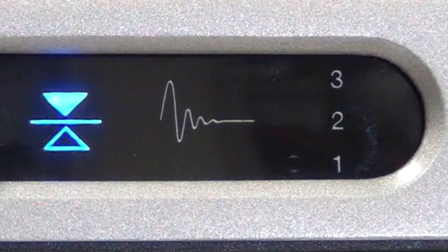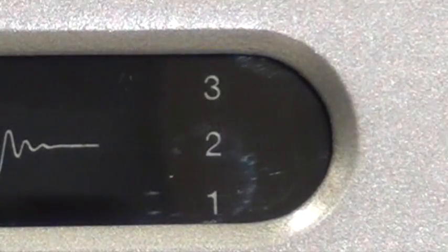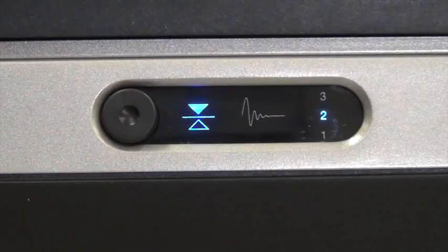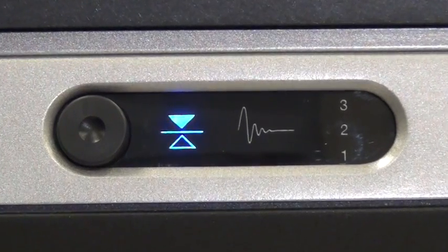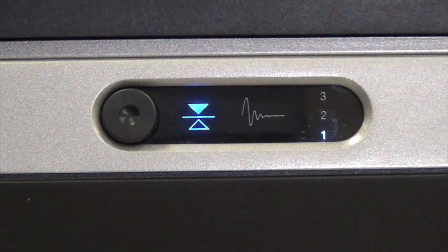Alternatively, the gain-match setting is user-selectable. If the gain-match indicator continues to flash even after restarting several times, press the button on the back to select the next lowest gain-match setting. No active gain — when no setting is illuminated and the isolator indicator is off — is also an option and may be required when using a very weak table. If the gain-match indicator flashes continuously on all three settings and the K400 is resting flat, then consider using a more rigid support table. Contact TMC for recommendations.